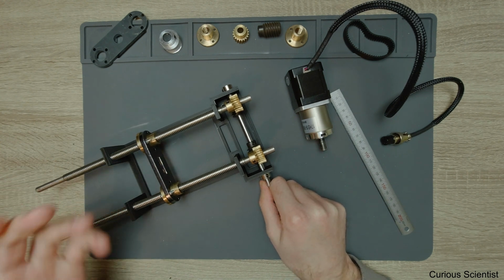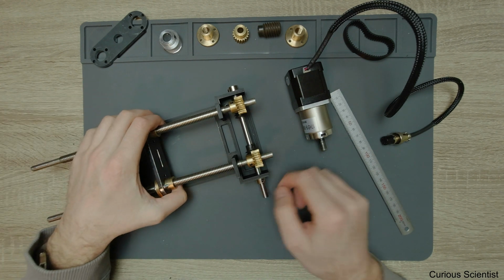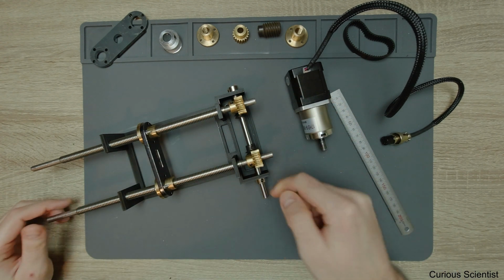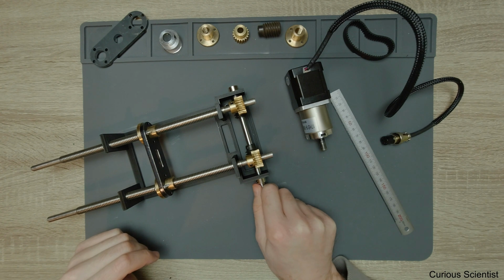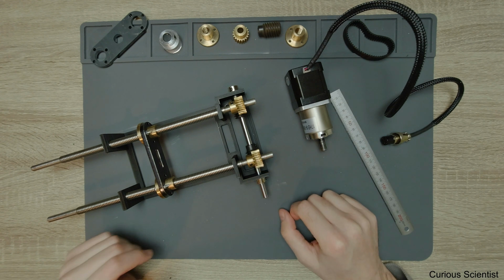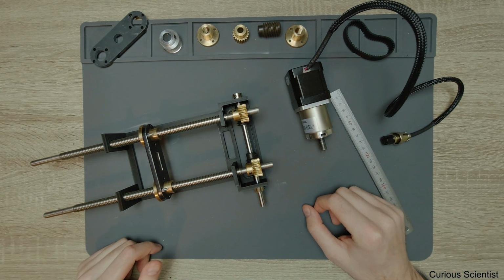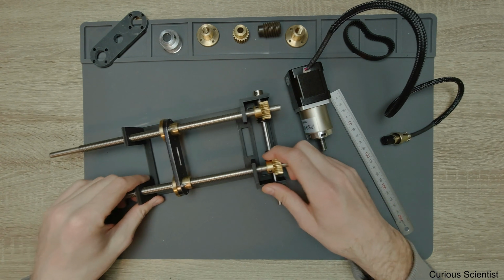So I just wanted to save time and material, but I wanted to focus on the position of the holes. So I will make a proper prototype of this part. So what is here, which encapsulates the worm gears and the shaft. And I will try to find a place where I can have these parts made out of metal, preferably some stainless steel. And then I will assemble a new machine, which will be much smaller than the previous. It will be this small.